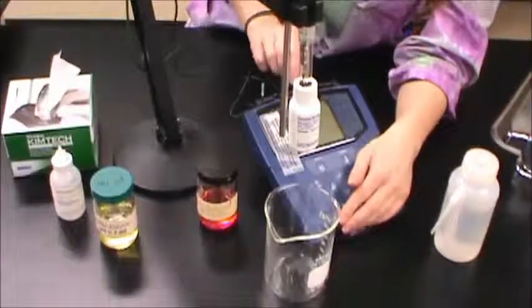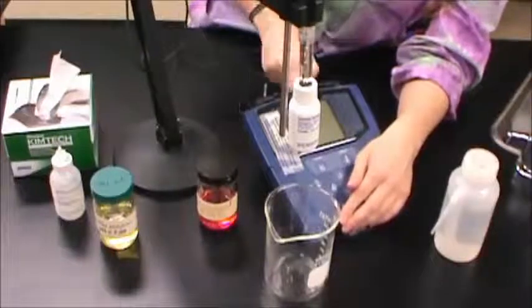Before you begin, also make sure the two probes are plugged into the appropriate ports at the back of the instrument.